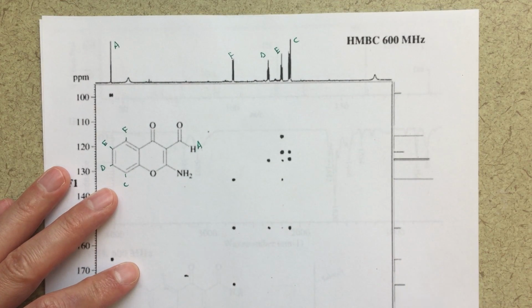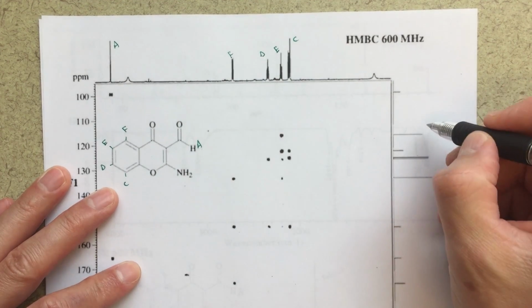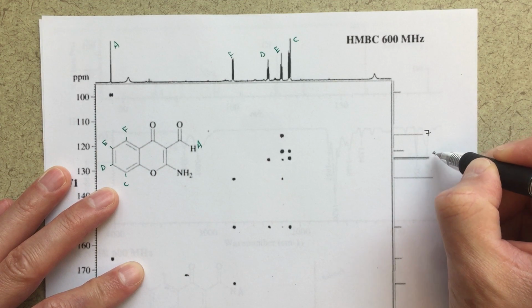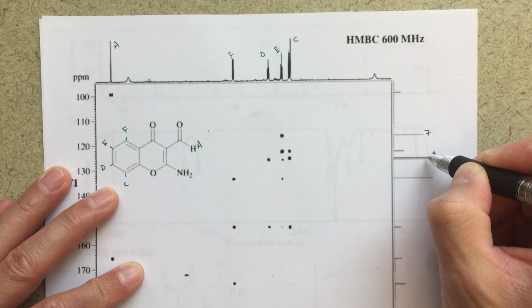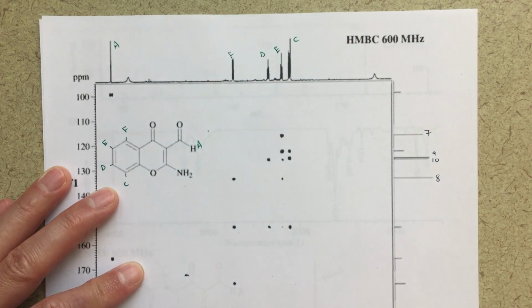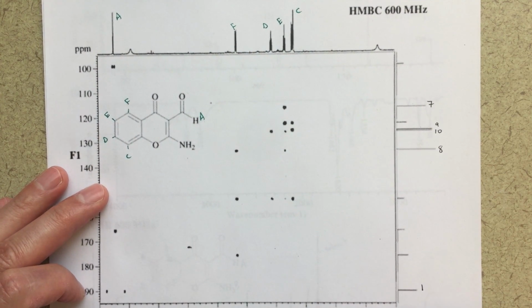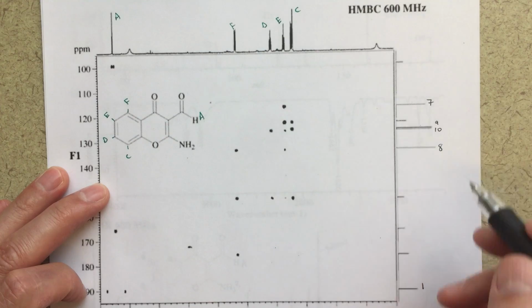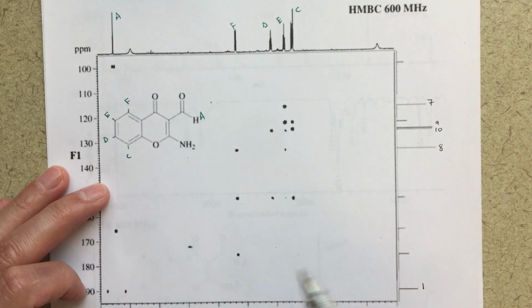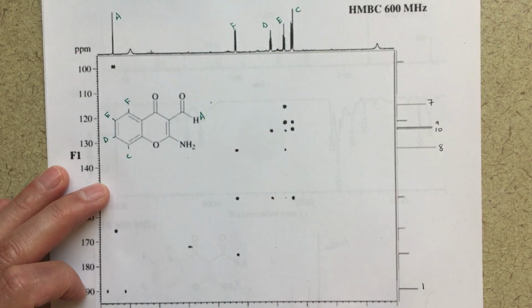For our carbons, what we already know at this point in time is that we know number 7, so this is 7. We would know that 9 and 10, so 9's on top of 10 right here, 125, 126. We know that this one is 8 at 134. And then we know that way down here at 190 that this is number 1. You guys probably can't see that right now. There we go. So that's what we know for our carbons. So we can start using that to make the other assignments, and also to confirm the information that we have so far. But without having some sort of starting point, it makes analyzing this HMBC much more difficult.